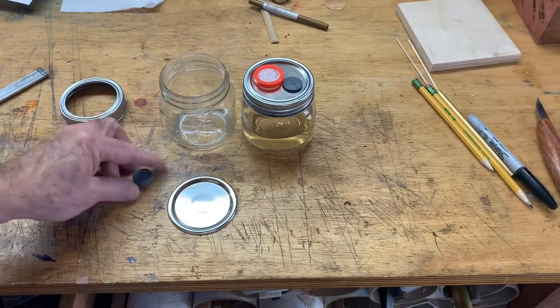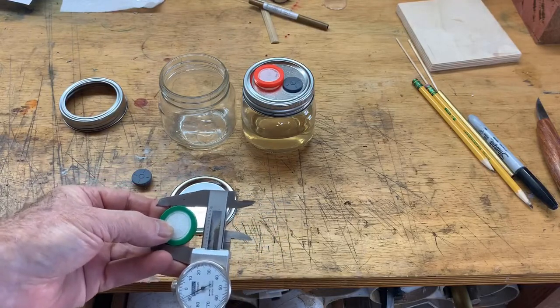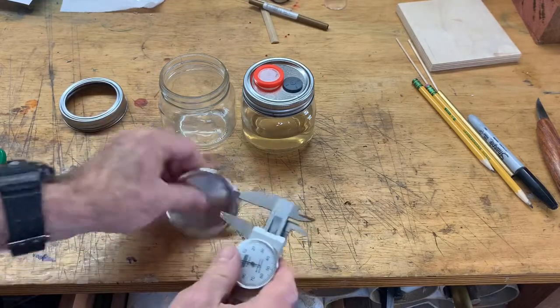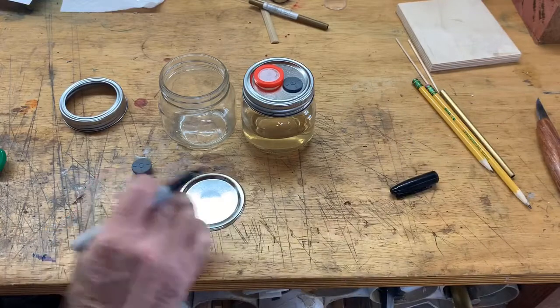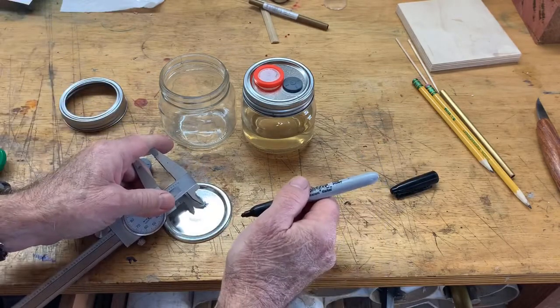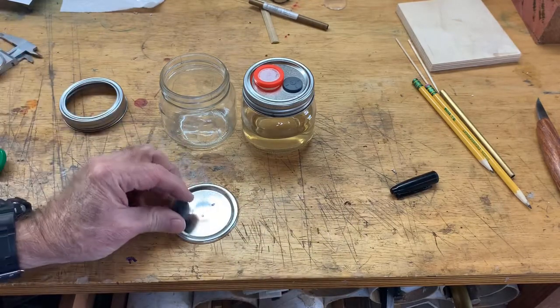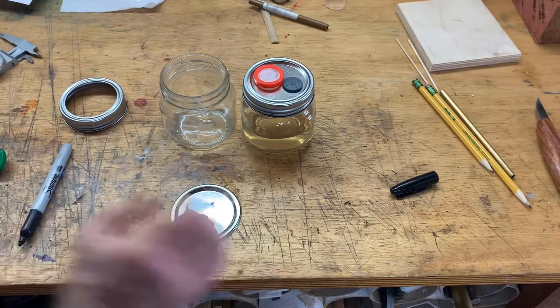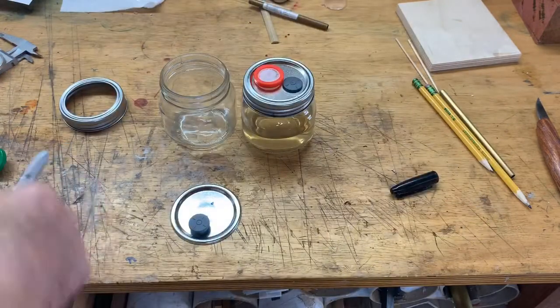That is the right size for this little end of the filter. To get both the injection port and the filter on there, I have to be a little bit careful where I place this. I measure the diameter of this to be around 1.2 inches, so I want to go 6 tenths of an inch from right there and put a mark where I want to drill the hole for the filter. The filter comes out another 6 tenths of an inch from that, so the filter will stop there. And then I put the injection port right there — careful not to get it too close to the filter, but not too close to the edge either. But it turns out there's enough room with a little bit of care.